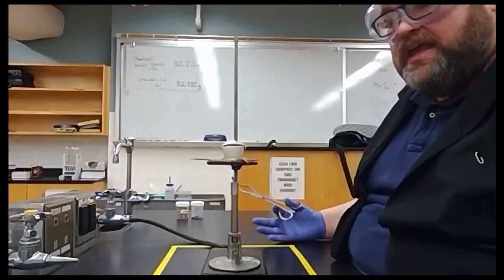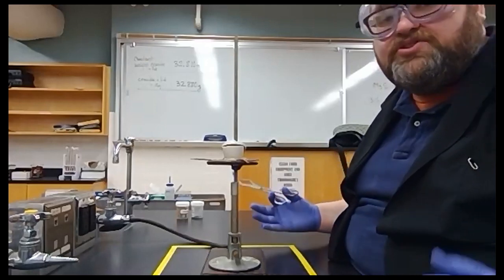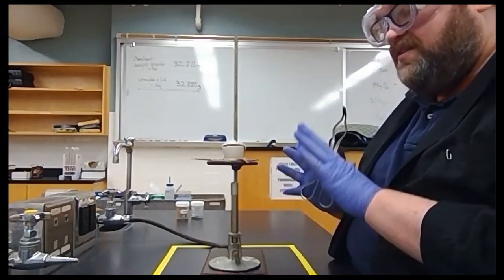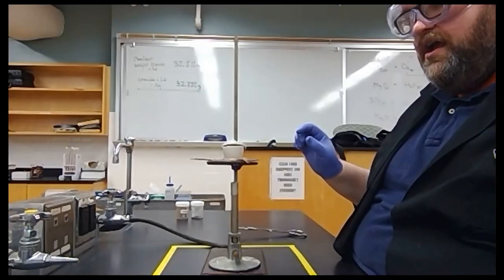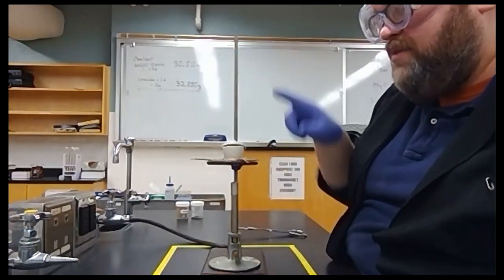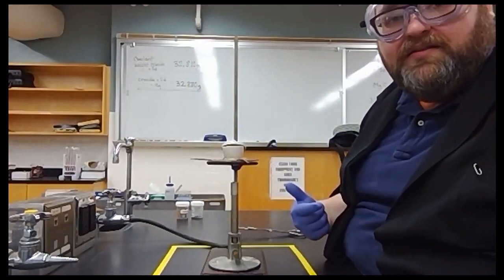After this, it's a waiting game. It can take anywhere from 5 minutes to 45 minutes for that magnesium to get hot enough to spontaneously combust, because that's what we're waiting for here, spontaneous combustion. Okay? So we're just going to set this here, leave it, wait. We're still waiting. What we're waiting for is that flash of magnesium fire. Okay? We'll see a bright light sort of come up out of this thing. We won't see fire, we'll just see a bright light. Once that's happened, we know that the magnesium has ignited.